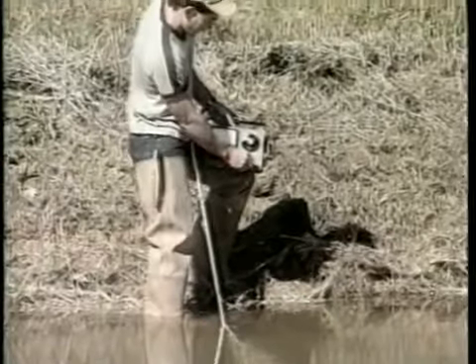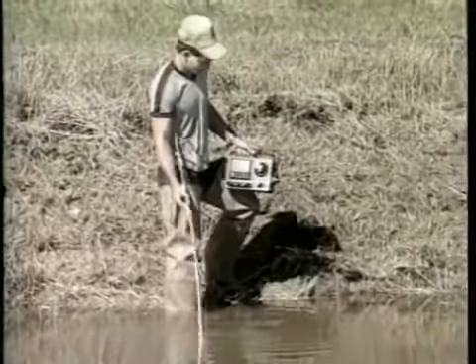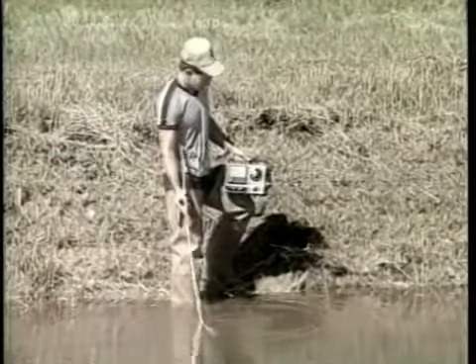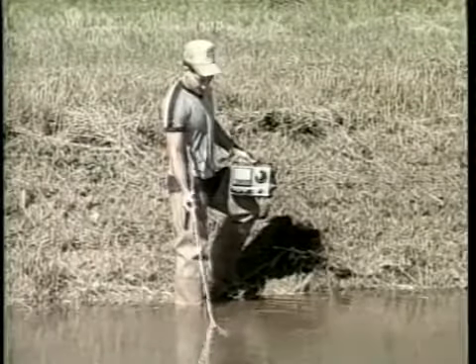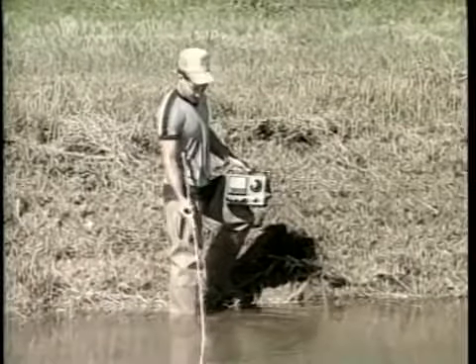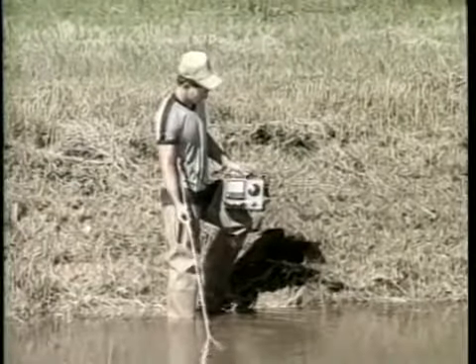The temperature of the pond water is then taken by placing the probe in the water and moving it back and forth. It is desirable to take the temperature reading where the oxygen reading will be taken. Be sure the reading is taken away from the pond bank, incoming water, aerators, and if possible with the wind at your back. Submerge the probe about 1 foot below the surface. The probe may be attached to a rod or pole with tape, which will allow it to be extended into the pond and reduce the cable stress.